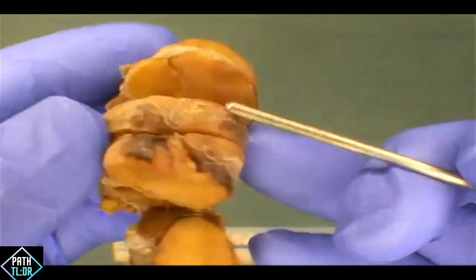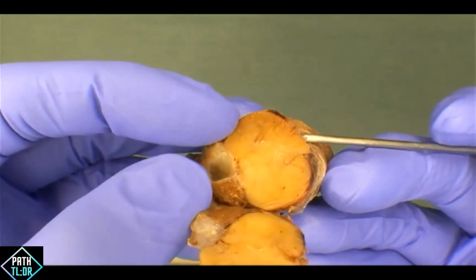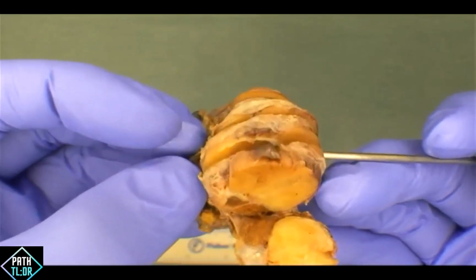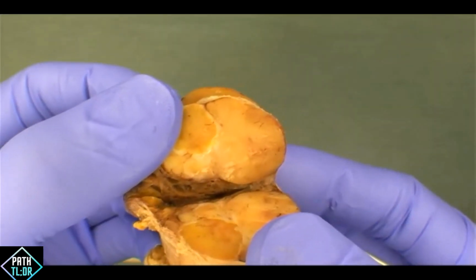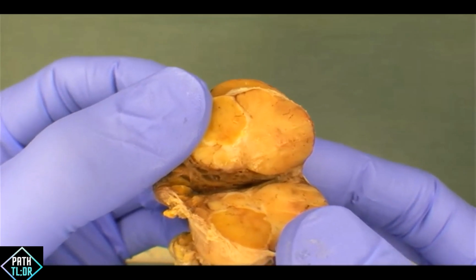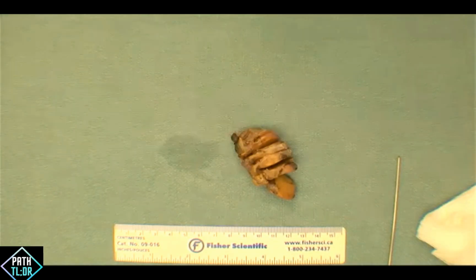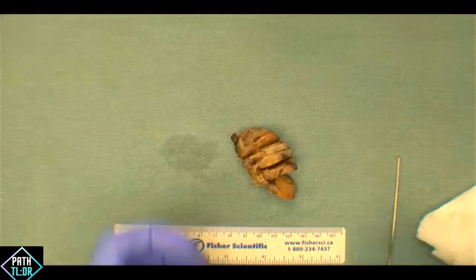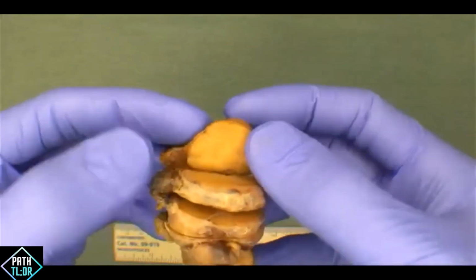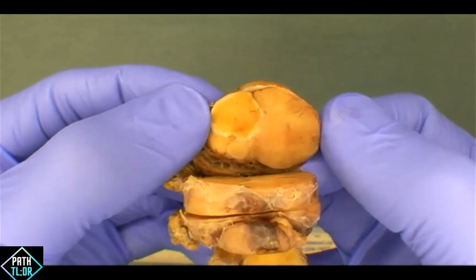Okay. And what are some thoughts then on the differential for this lesion in terms of what it might be? So we've got a follicular neoplasm. Yeah, great idea. Okay, multinodular goiter, possibly. Any other considerations? Good. Excellent. Adenoma, a non-oncocytic neoplasm. Any votes for cancer? Anybody voting for cancer? I find it interesting that people are gravitating towards a more benign kind of thing, which I would agree with. Absolutely. Yeah, so I think given the cut surfaces and how well circumscribed this is, considering this to be an adenoma or some type of follicular neoplasm is higher in order in terms of our differential.